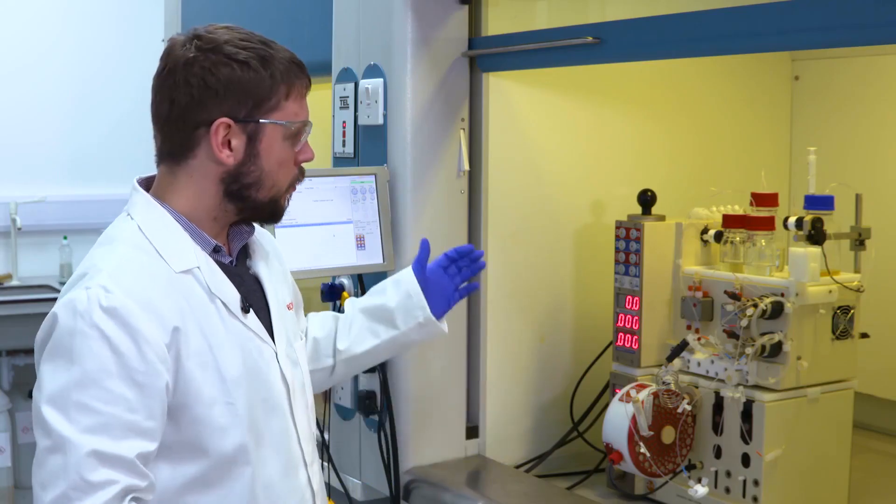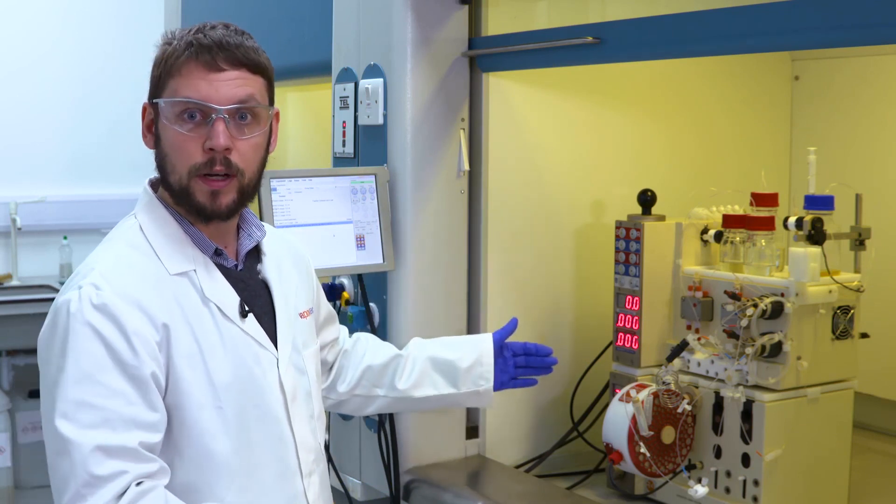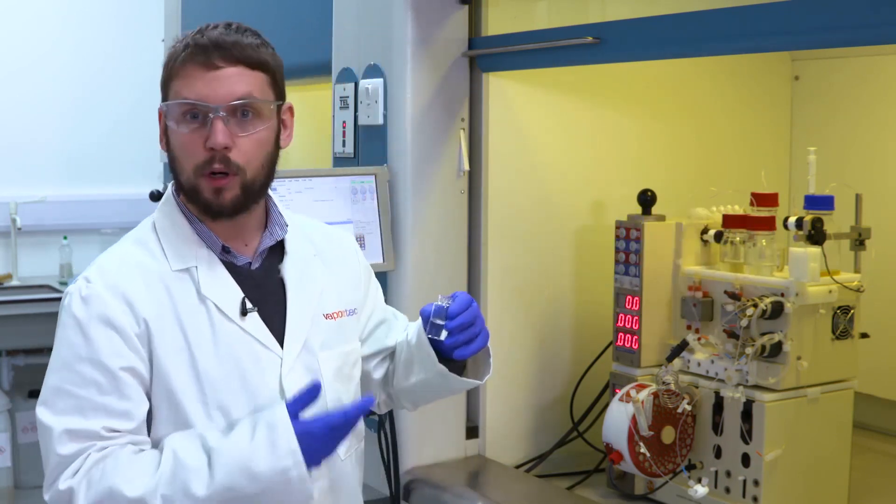So the experiment is finished. FlowCommander has taken the RCUs through its automated cleaning, and it's collected the product for me.